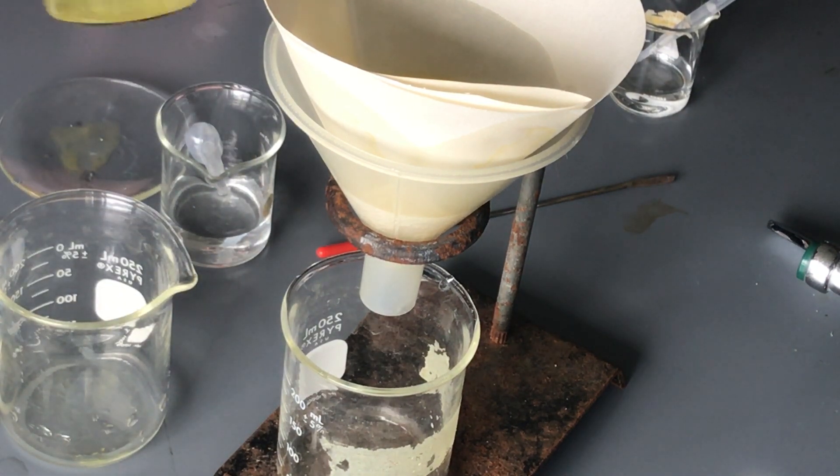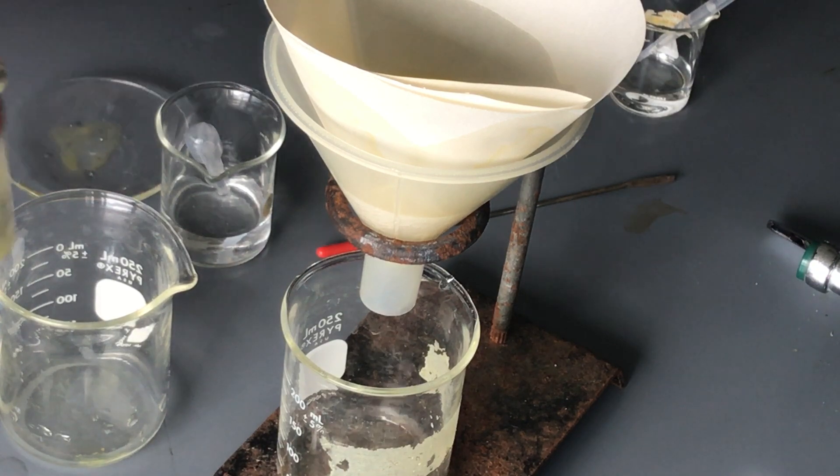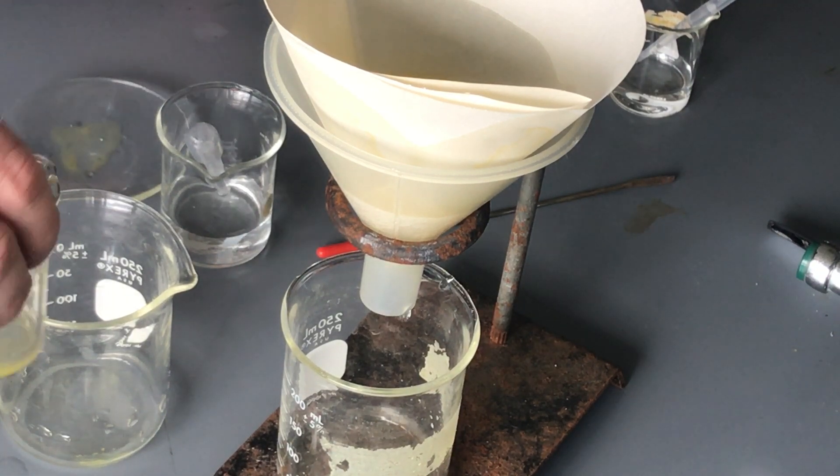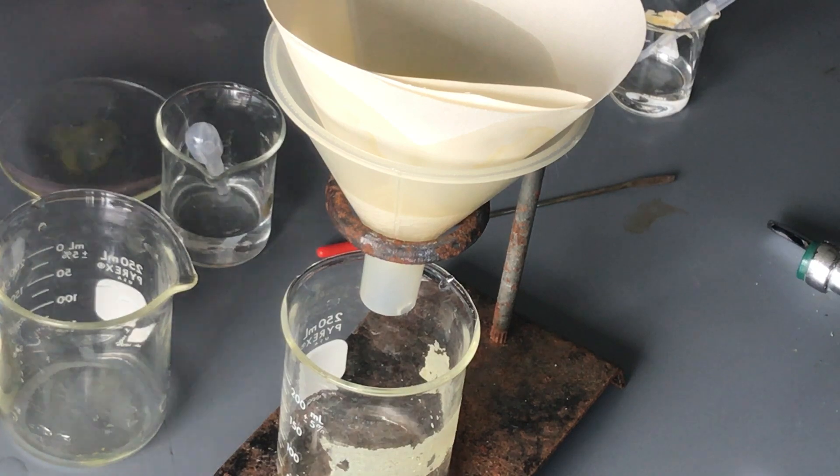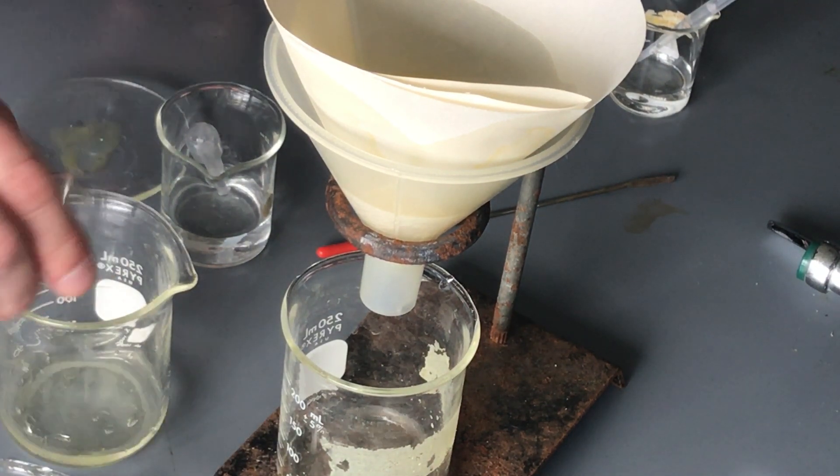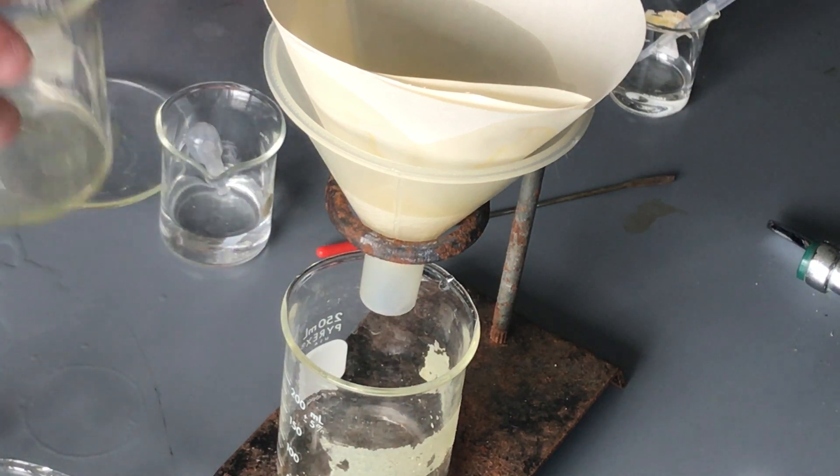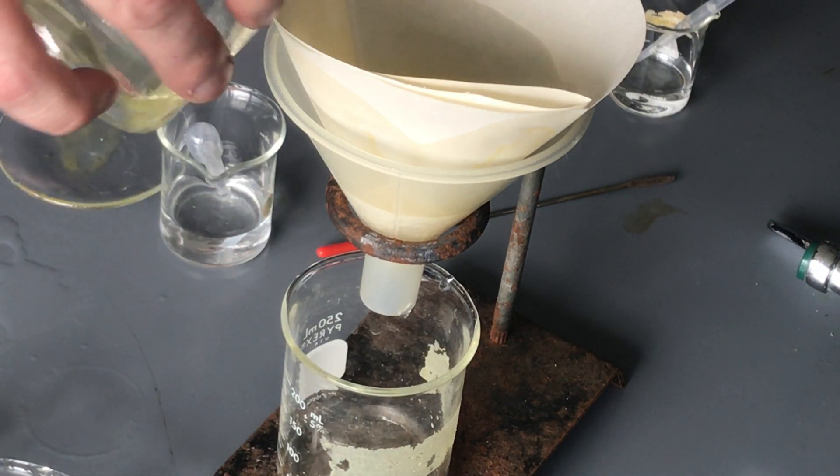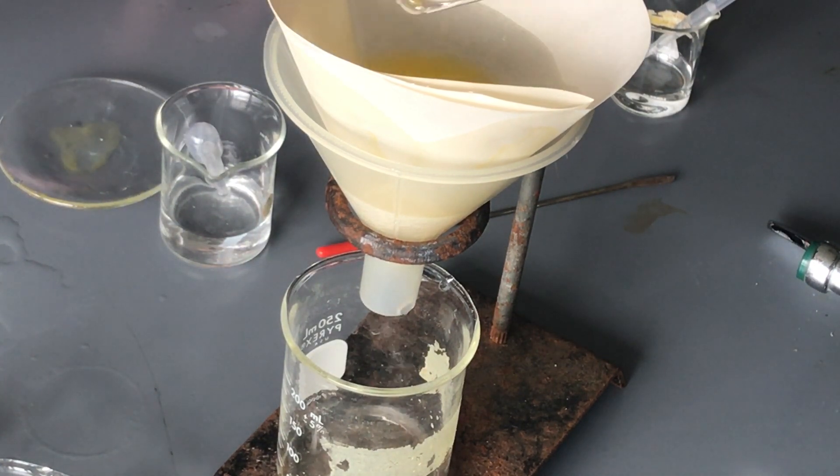And so I still have a slight yellowness to these and so we're just going to try to loosen up as much as we can without spilling it like I just did, but I'll wipe that up. Just trying to get as much as we can loosened off, get those consolidated and with the rest. What I'll often do is I'll dry with a paper towel and once I have the paper towel I will actually keep the paper towel in with the disposable material inside a plastic bag just so that we try to reduce as much.